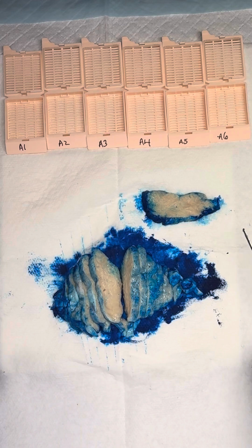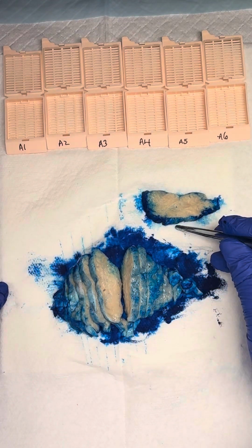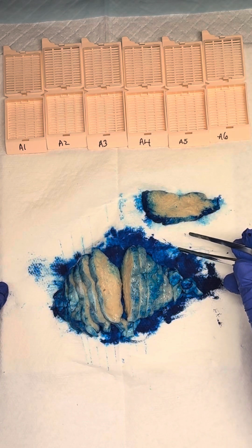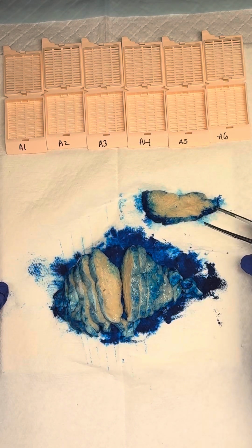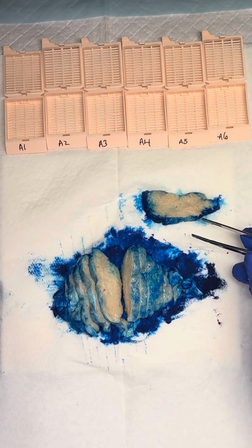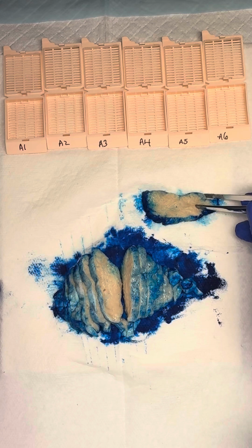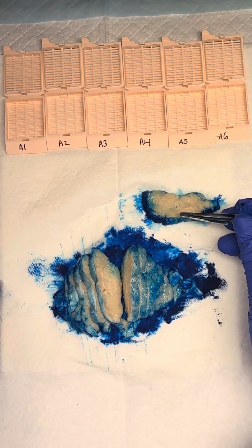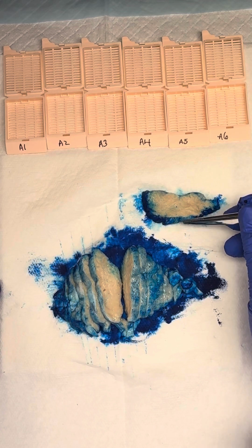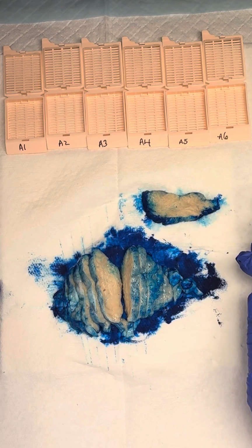So we would want to measure our mass to our margin or our inked outer surface. In this instance, we would only have one measurement, and since our lesion is completely encompassing our specimen, it's inherently going to abut our inked outer surface. If it wasn't involving the entire specimen, or you had orientation, you could provide the measurement of the mass to your closest inked outer surface or to your anterior and posterior surfaces.